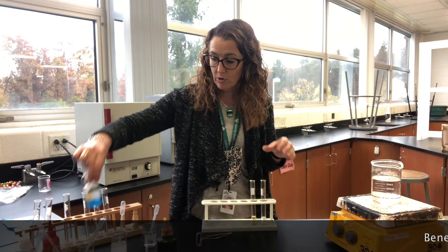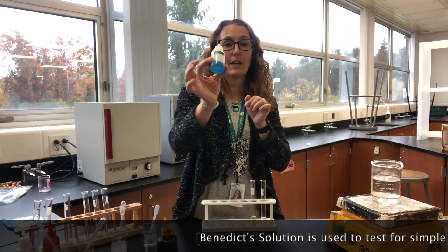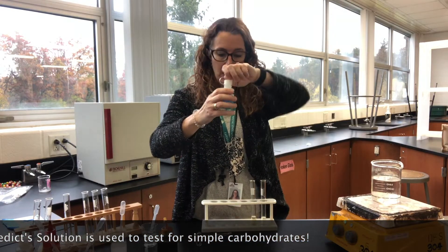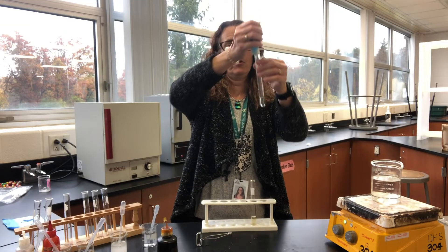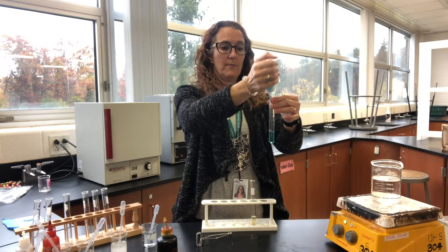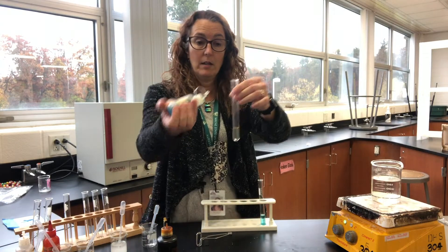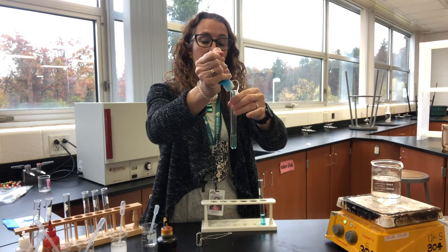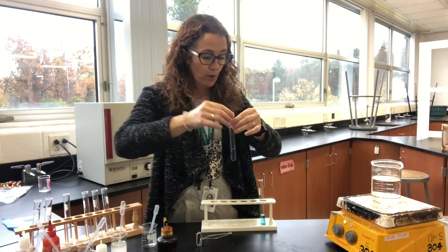For this test we use a reagent called Benedict's solution. Benedict's solution is a pale bluish color with a tinge of green. I'm going to put about 20 drops into the control first, and then the same amount into my sugar.